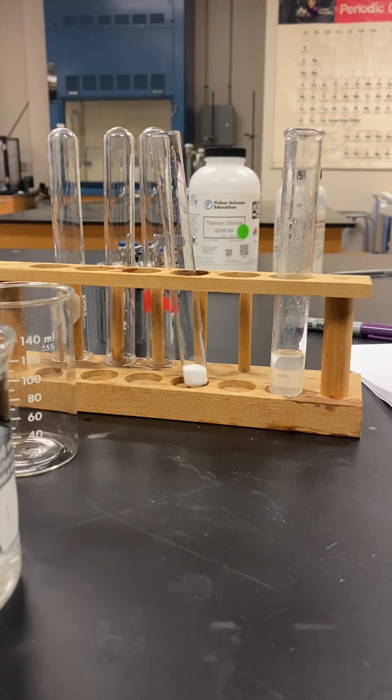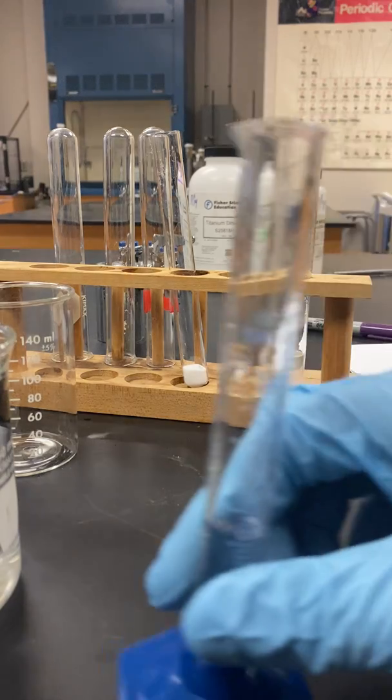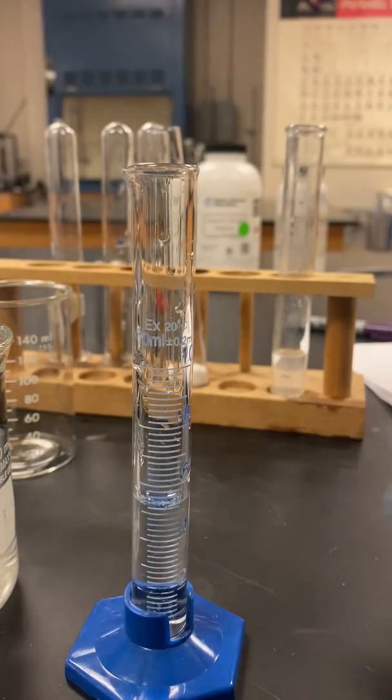Look at that. So this is the potassium chloride. What I've done here is I've filled a graduated cylinder with 5 mL of room temperature water.